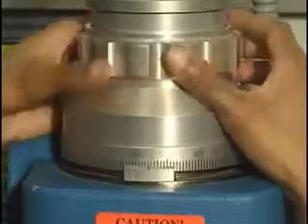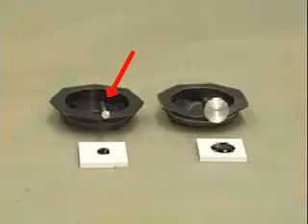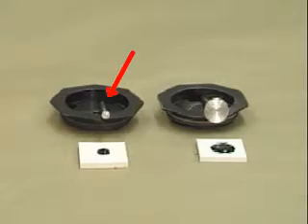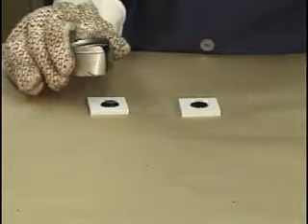Rotate the micrometer dial and set the gap to 1.05 millimeters if testing original or RTFO-aged binders. If testing PAV-aged materials, set the gap to 2.05 millimeters. Sample Preparation. Heat the binder sample in an oven until the binder is sufficiently fluid to pour. Stir the heated sample to remove any entrapped air and to ensure homogeneity. After the binder is free of air bubbles, pour the binder into the silicone molds and allow the samples to cool to room temperature.